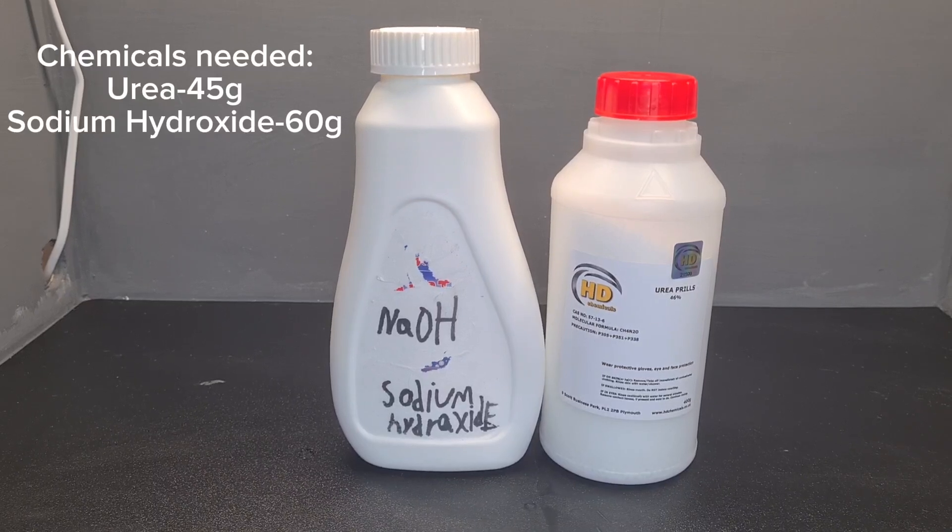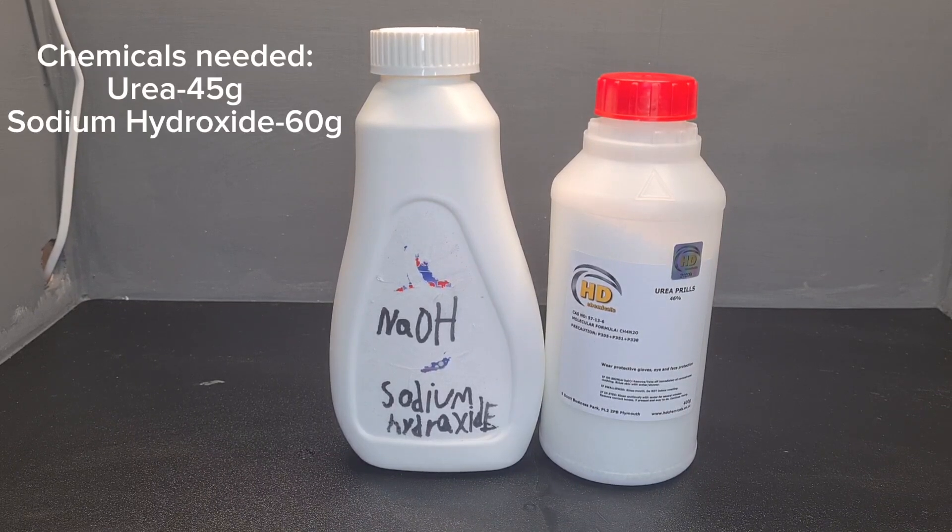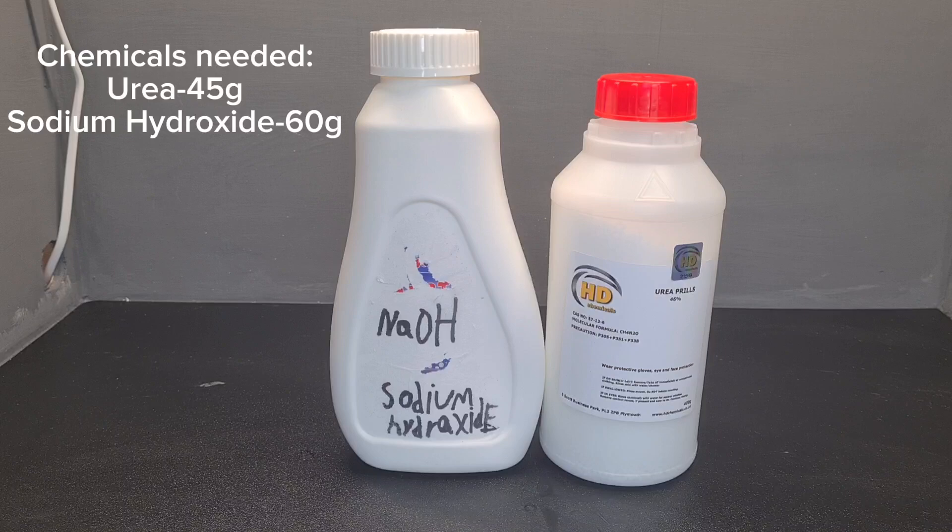Okay, so all you're going to need for this is 45 grams of urea and 60 grams of sodium hydroxide.